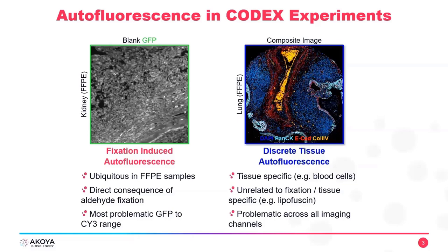So there are two types of autofluorescence that I would like to talk about. First one is on the left-hand side here. This would be fixation-induced autofluorescence. Most, probably all of you know that fixation of tissue actually triggers autofluorescence. Autofluorescence is a direct consequence of aldehyde fixation. And you can see this very, very clearly in this image here on the top left.